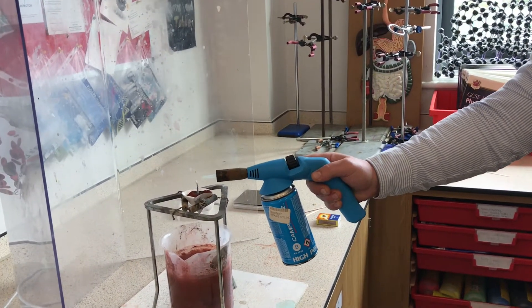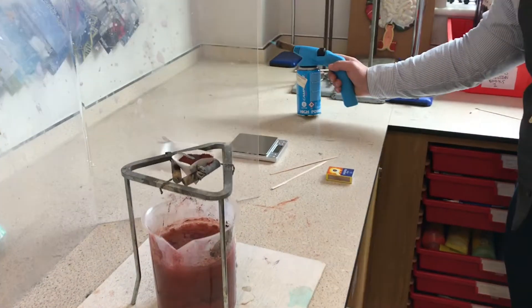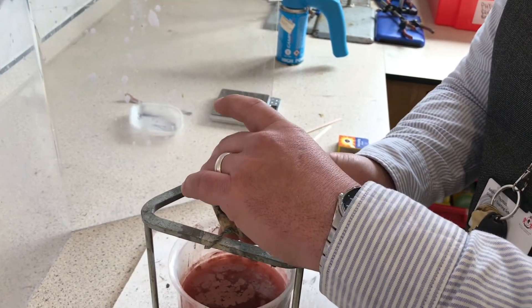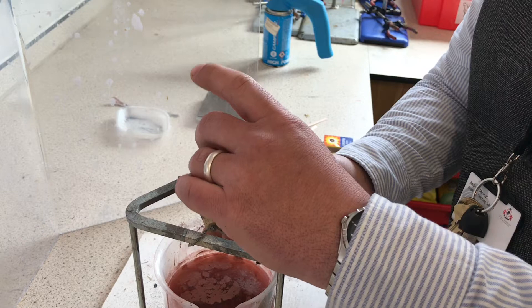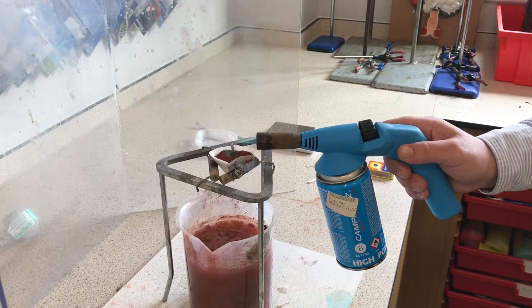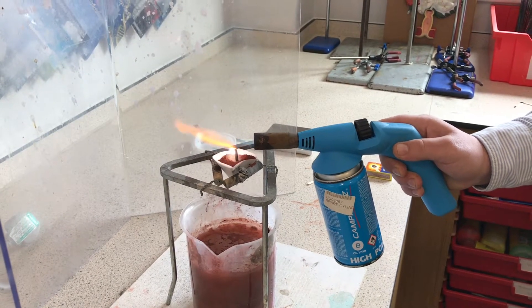The trick is to light the top without burning the paper. Let's see if we can do it. We'll start again — this is science, everybody, it doesn't always work first time. We've got it standing up. Here we go, take two — as soon as it starts to light we stand back.